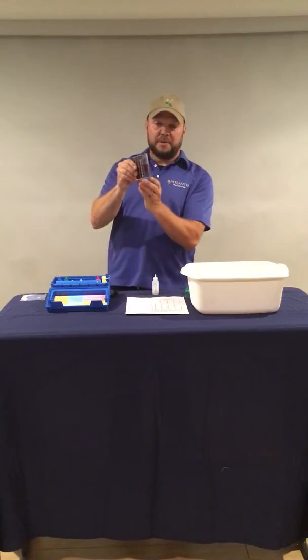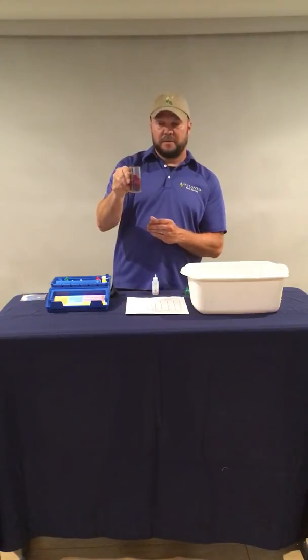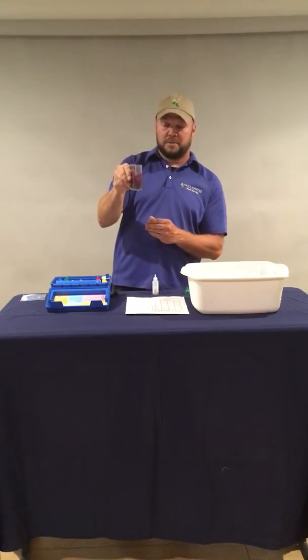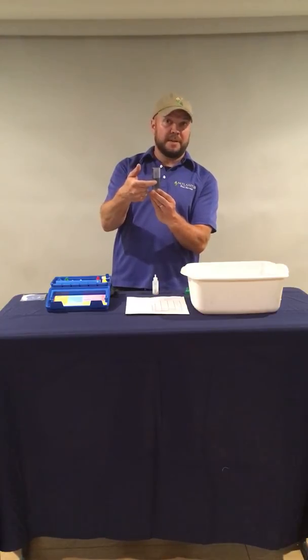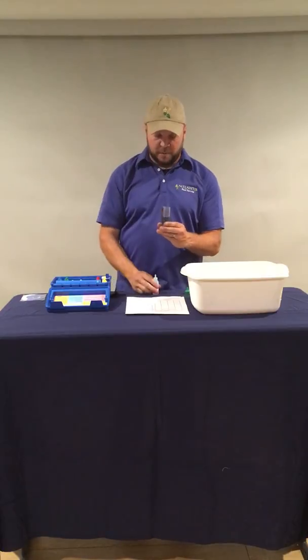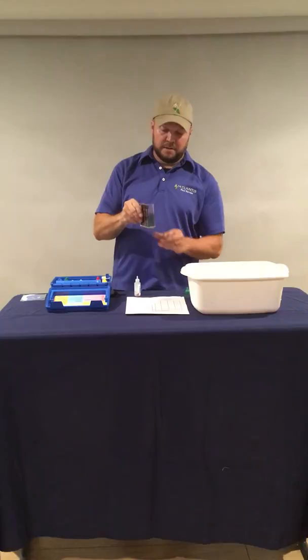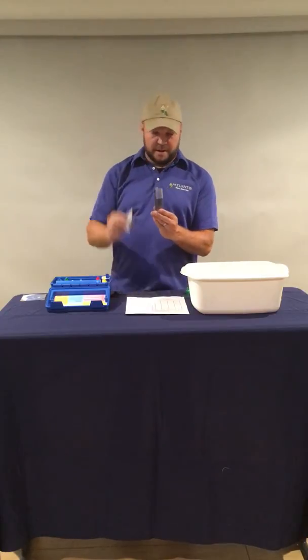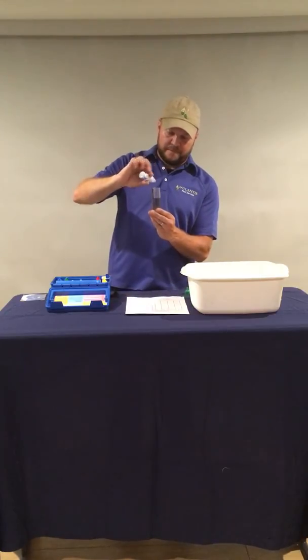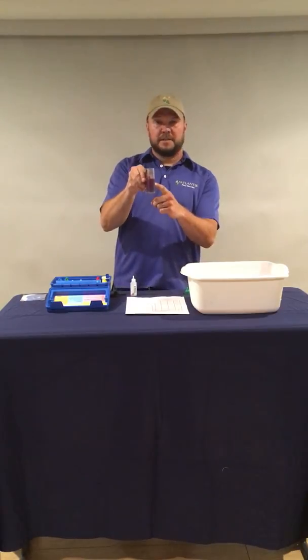All right, with that third drop, you can see it's starting to turn pink. We need to see if it's going to turn all the way pink or if it's going to revert back to the green, or sort of somewhere in the middle. So after we swirled it a bit, it's gone back to being green. That means we're not done yet. We're going to add 1 more drop, and that usually will tip it over the edge. Almost, not quite all the way there. We're going to do 1 more drop. All right, now you can see our sample has turned pink.